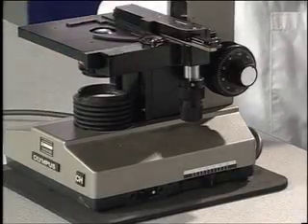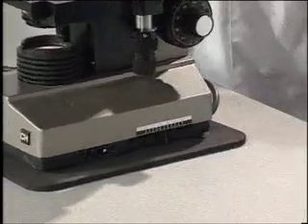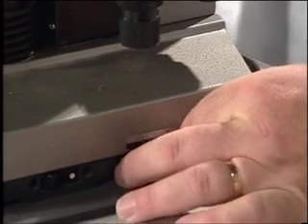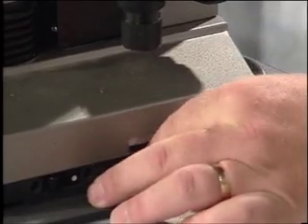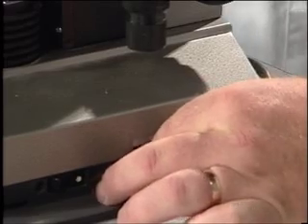The next device is a dimmer switch on the side there. It goes from 0 to 10, so if it's too bright, you can turn it down. 0 is right off, so make sure you have it somewhere within 1 to 10 to start with.